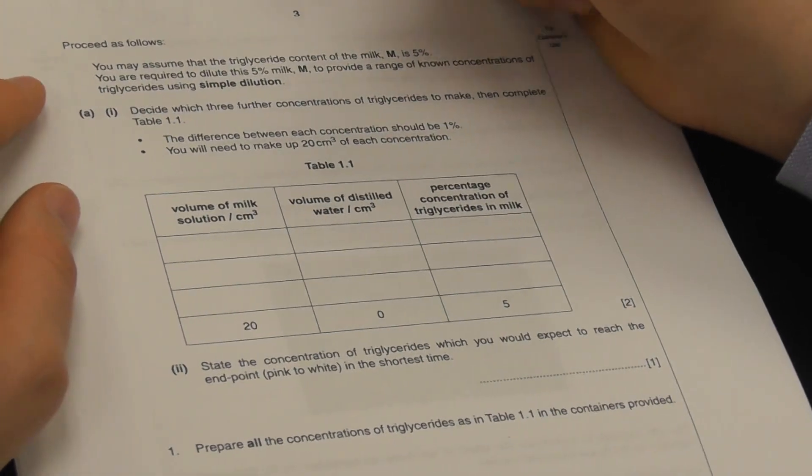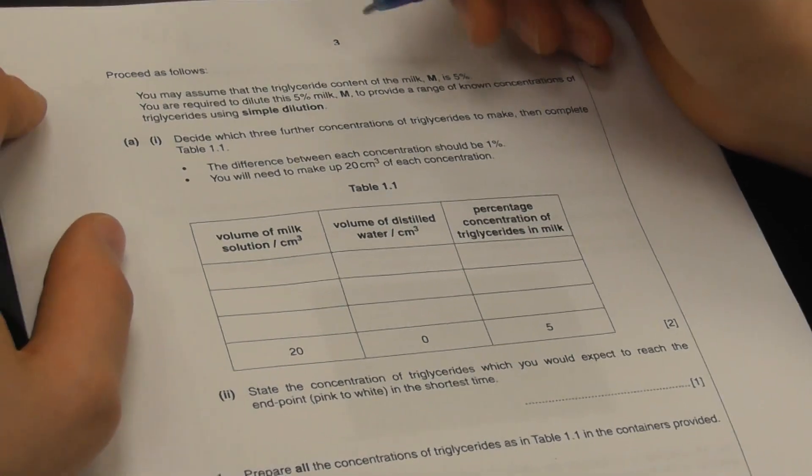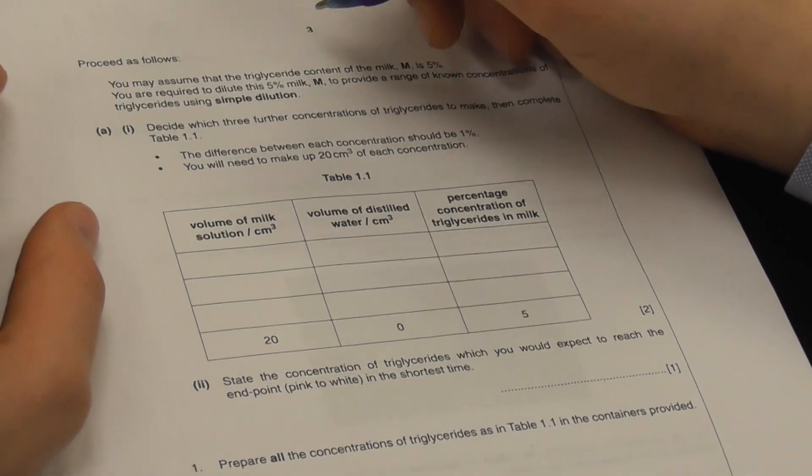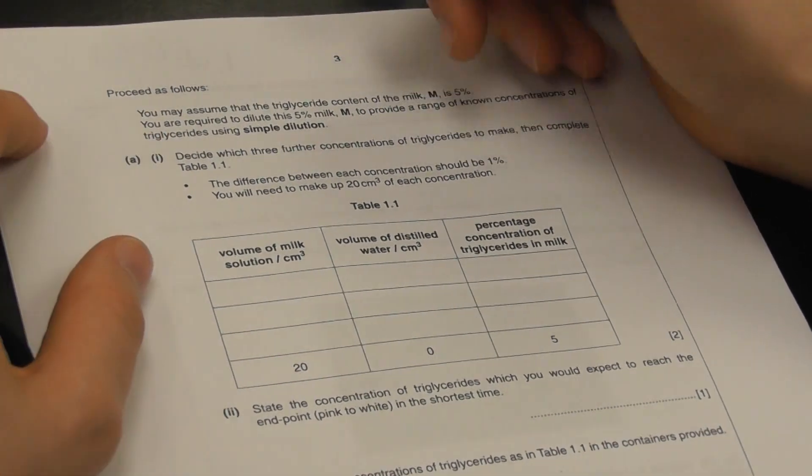So we're required to dilute this 5% milk. By the way, forgive the costume change.